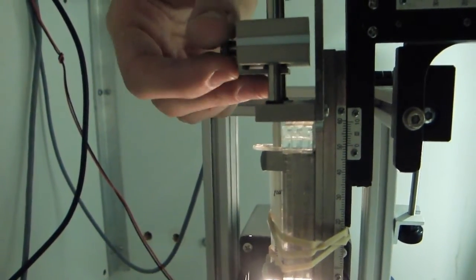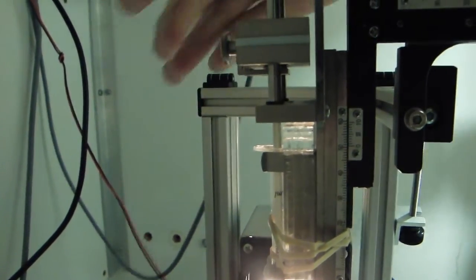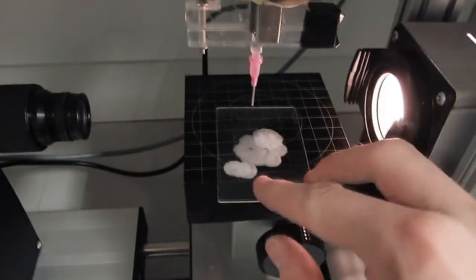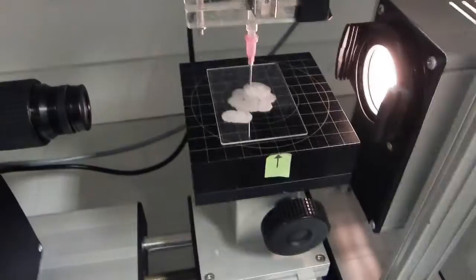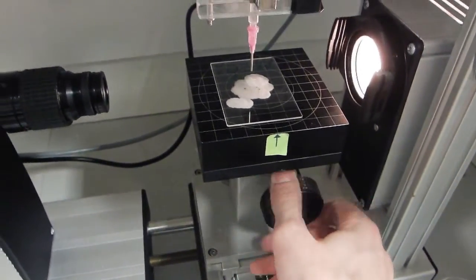Now we tighten the retention screw. Here the surface we're using is polypropylene dissolved in xylene. We place the sample on the stage and raise it to the appropriate height.